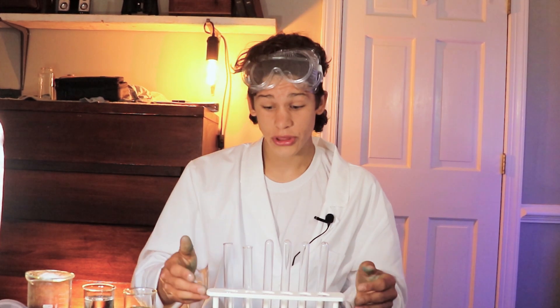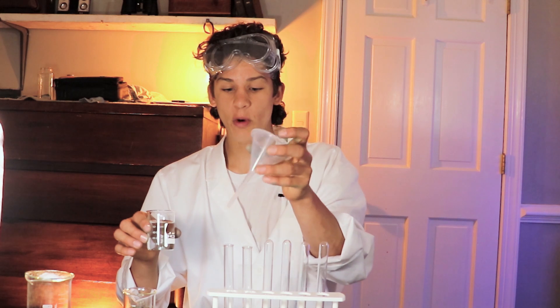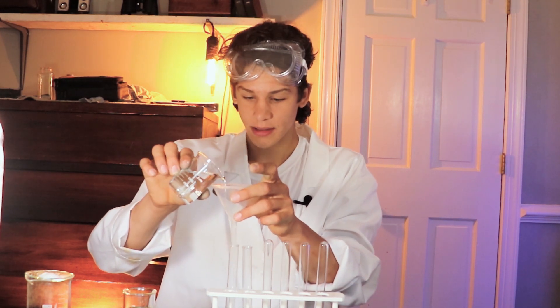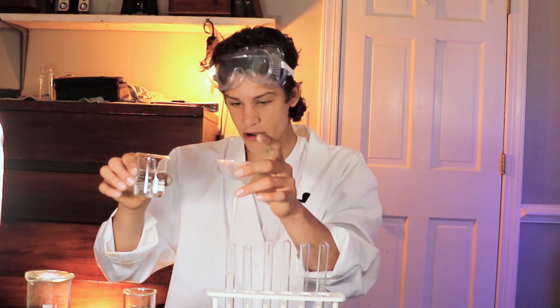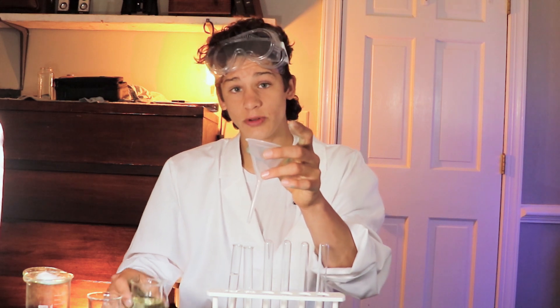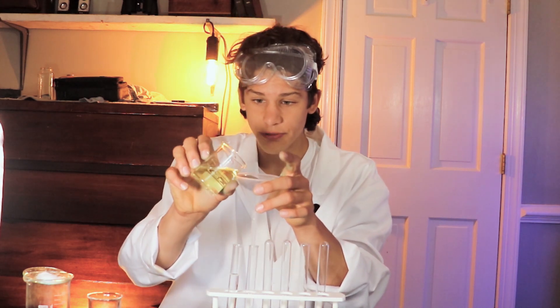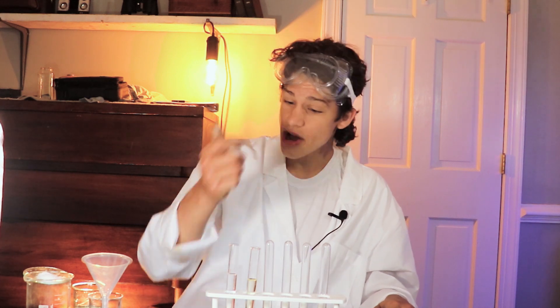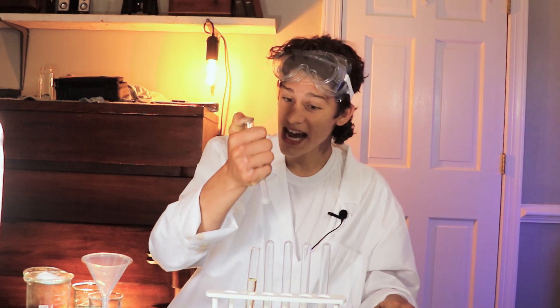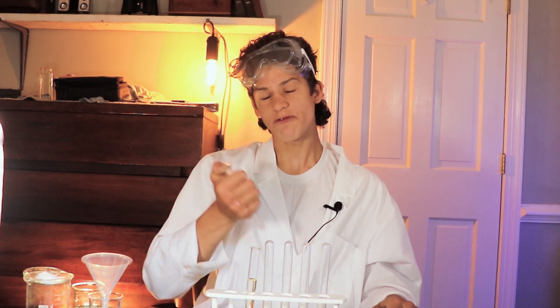After you've covered both test tubes with a little bit of salt, take some water and fill one test tube three-fourths of the way up — it doesn't have to be exact, just estimate it. Then get your vegetable oil and fill the other test tube three-fourths of the way up as well. Once both test tubes are filled, take your thumb, cover the top really tight, and shake it. Give it vigorous shakes for several minutes.